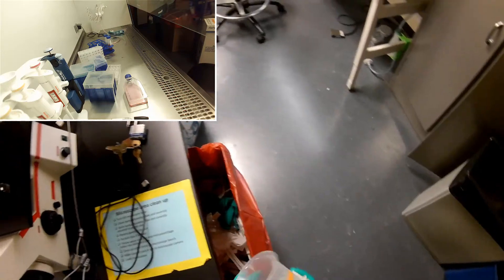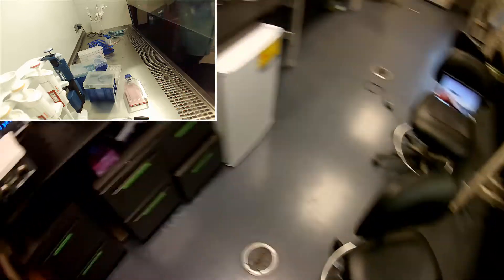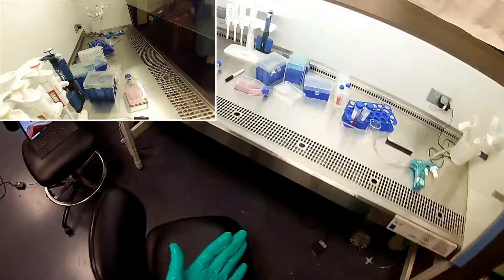And then we're going to make sure we put the tip waste into our biohazard. Okay, so we're back.